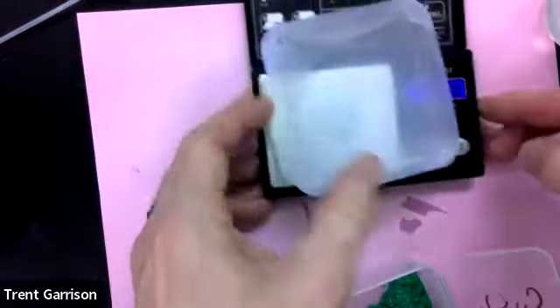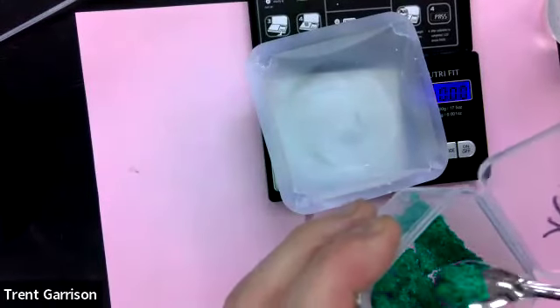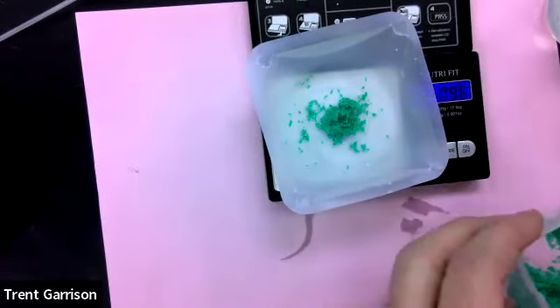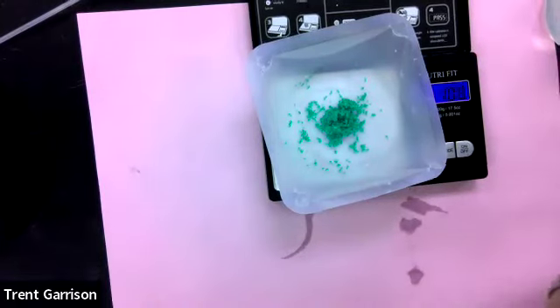I'm just rinsing and drying. That's the sound you're hearing. So let me put this closer to you. So now my boat weighs nothing. We're going to put 1 gram in. And there's your 1 gram.